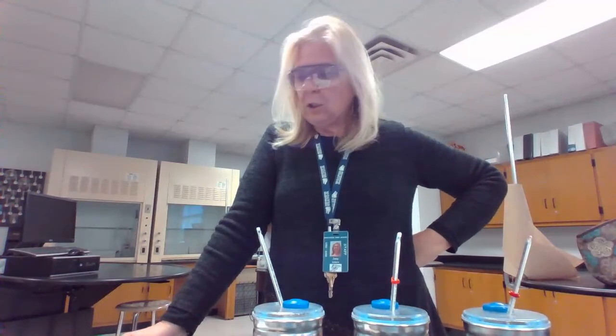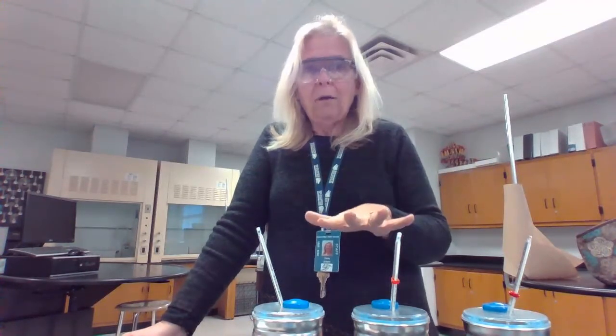The water should be a positive value because the water gained the heat. It's also doing final minus initial. So keep that in mind. If you can calculate the temperature change amount of energy for the water, then you can use that as your Q, but change the sign so that you can solve for the missing specific heat capacity of each metal. You should have a specific heat capacity for aluminum, one for brass, and one for copper, and then you should have a % error for each of those as well.